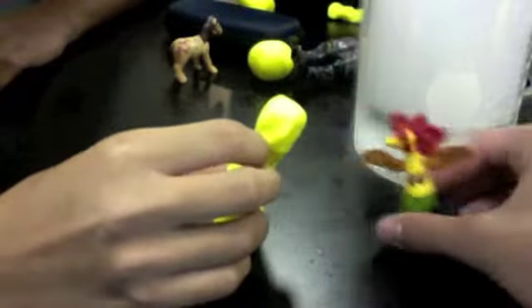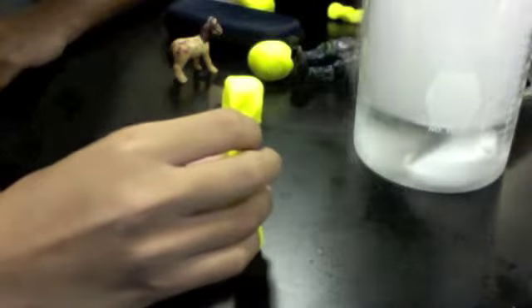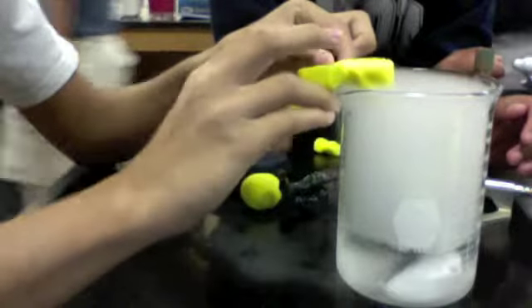Don't go in there. There's dry ice. Ooh, dry ice. Let's see what's in here. Oh, wow. It looks so cool with all that fog. Oh, what's going on?